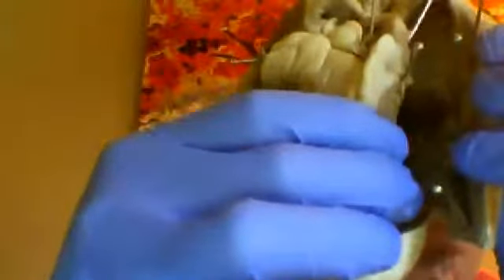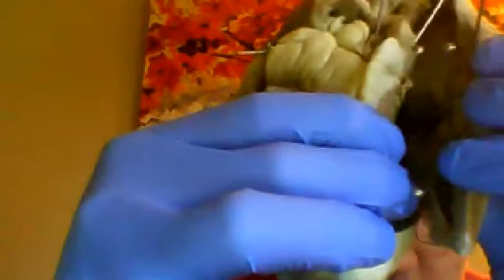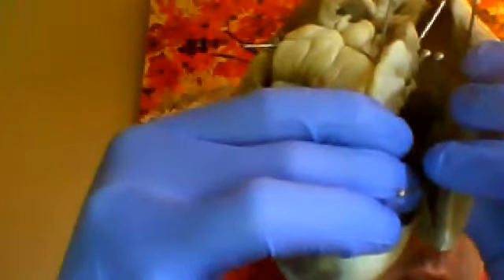The pulmonary trunk sends blood to the lungs so that blood can be oxygenated. At this point, the blood going through the pulmonary trunk is deoxygenated. It picks up the oxygen and then is returned back to the heart via the pulmonary veins.